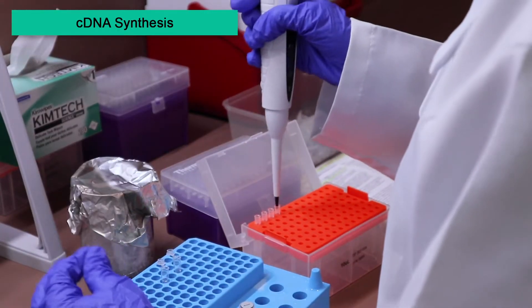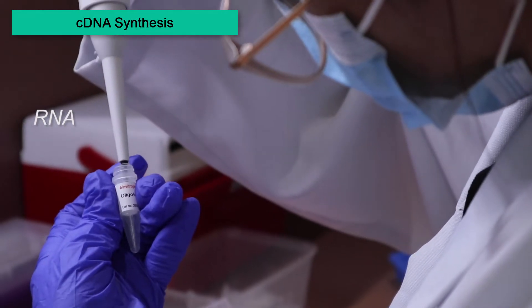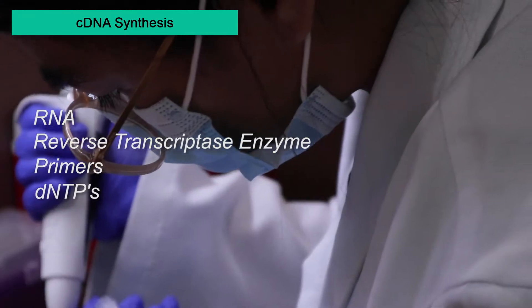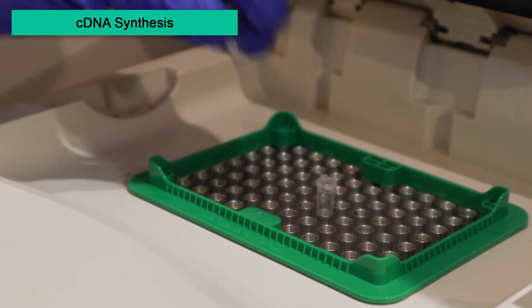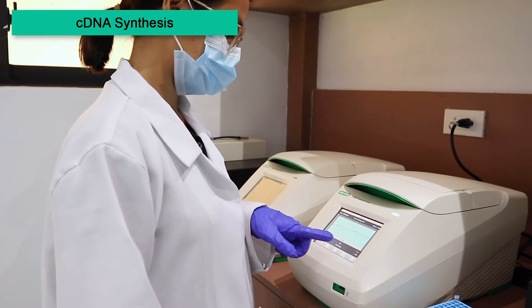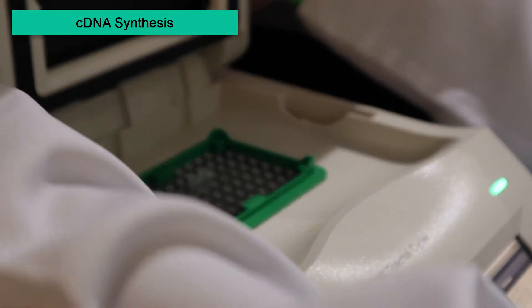The RT experiment is also called first strand cDNA synthesis, and requires the following: RNA, which serves as the template for the reaction; a reverse transcriptase enzyme; primers; and dNTPs. RNA is first mixed with primers and dNTPs and incubated at 65 degrees Celsius to denature RNA's secondary structure. This is chilled quickly on ice to let the primers anneal to the RNA. Then the RT buffer is added to the mixture and incubated at 42 degrees Celsius.